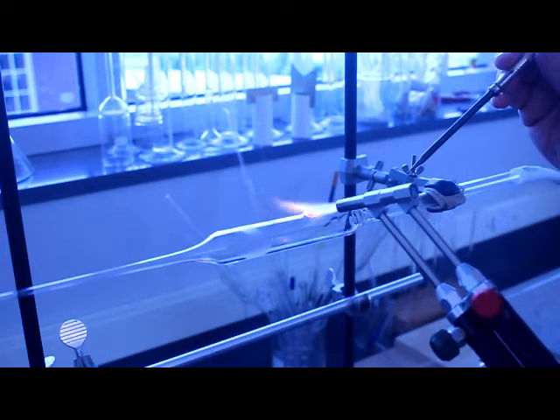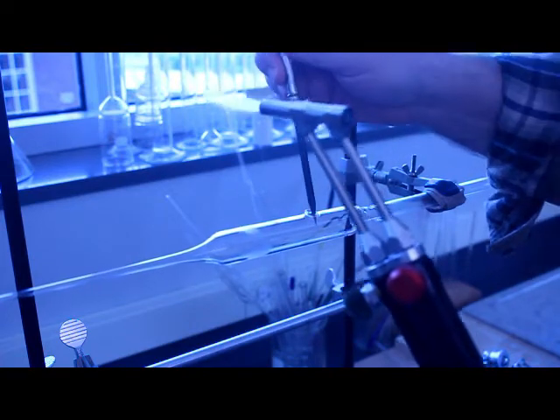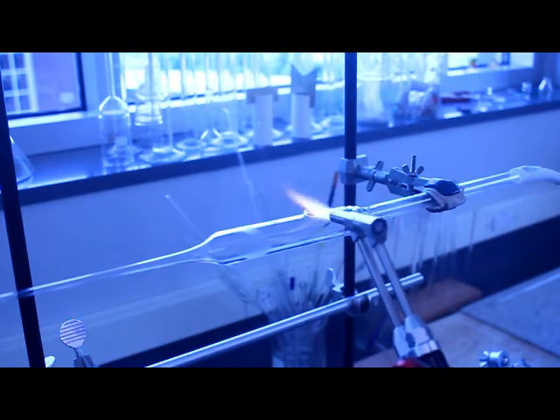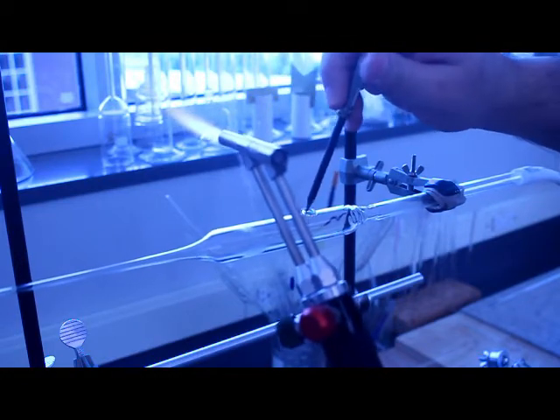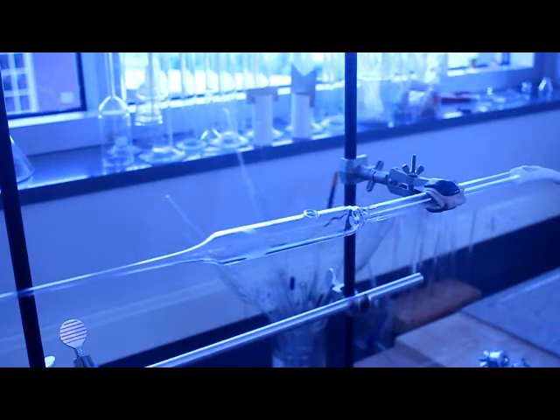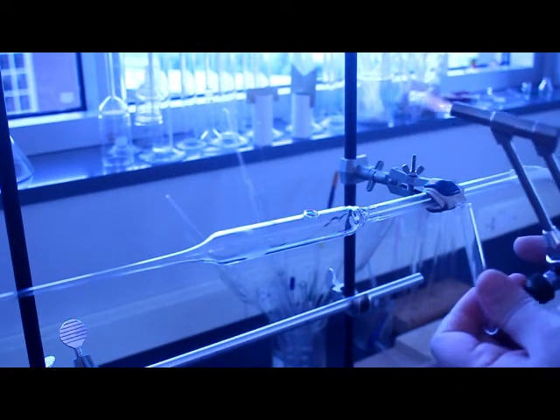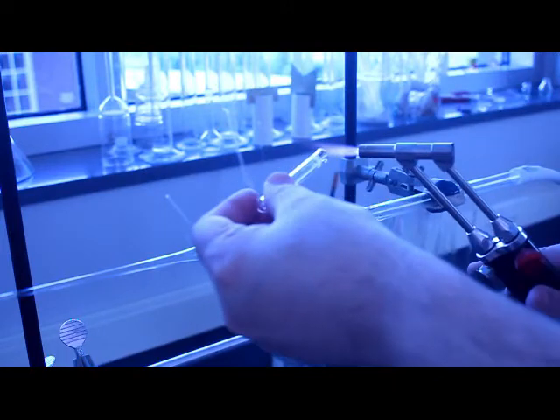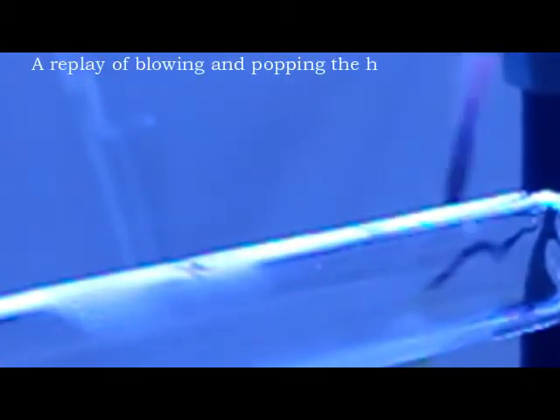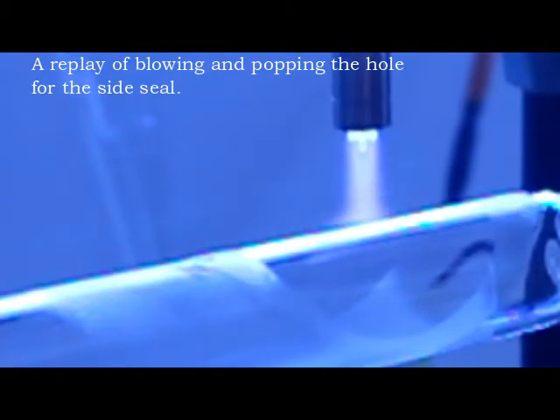Right now this is basically me doing some stuff quick and dirty as a demonstration. You'll see a little bit later on when I do try and make the side seal I'm off-center which is disastrous, but fortunately I was expecting to be off-center because again I haven't done this in a while. There I am knocking the torch, basically turning the torch off accidentally so you can see I'm struggling with this. But I actually already had a plan of if I was off-center of how to fix it, specifically to bring in a glass rod and do that. What I'm thinking about from a teaching point of view, a video series point of view, is to have mistakes of glass blowing and how to fix them or to patch them.